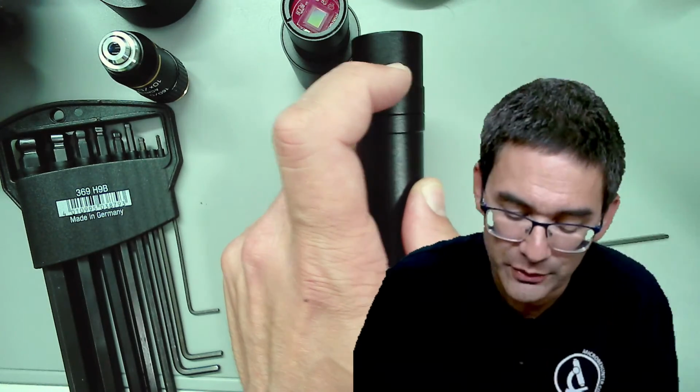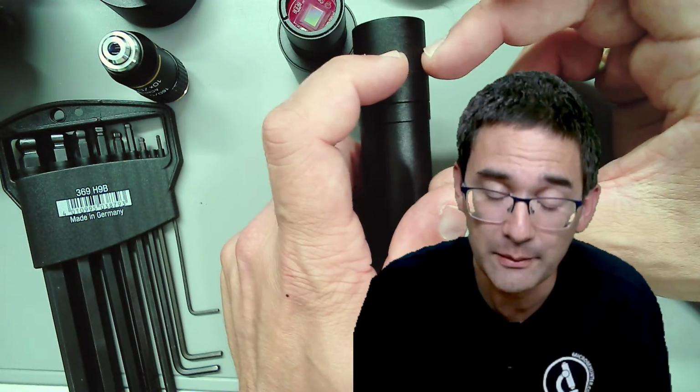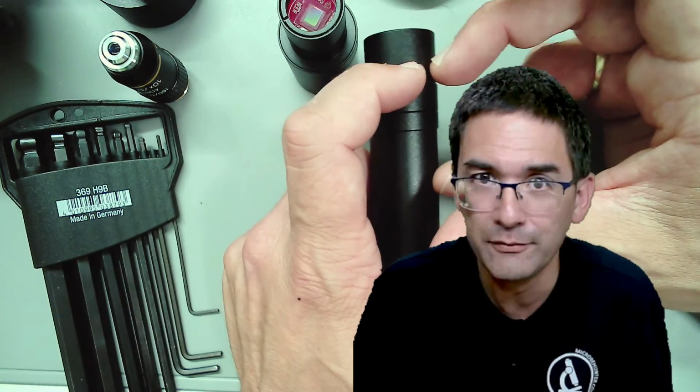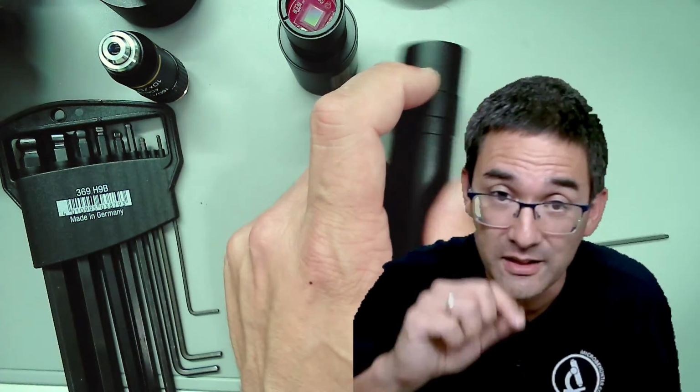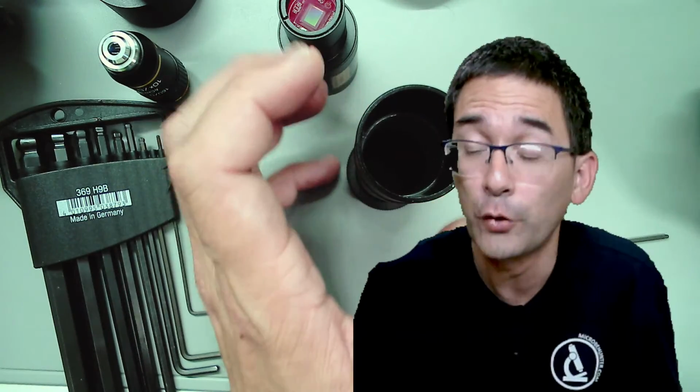Then you measure it out and subtract the distance from the front part of the camera to the sensor. But I have not even been measuring. I just estimated this. I roughly held the ruler there and said I'm just going to try it out as a proof of concept, and later on I adjusted it a little bit.